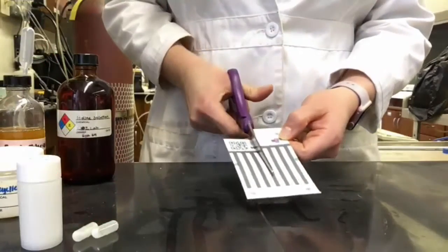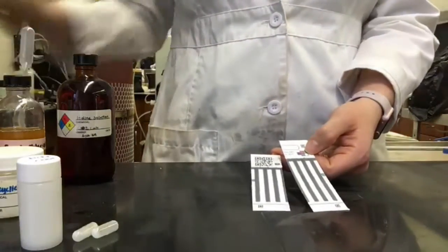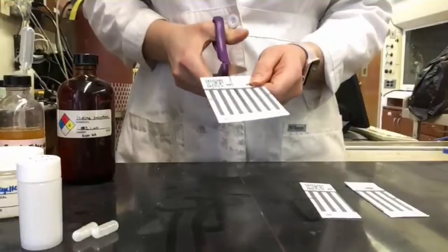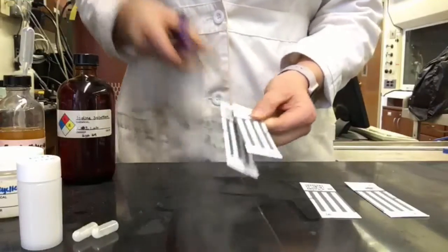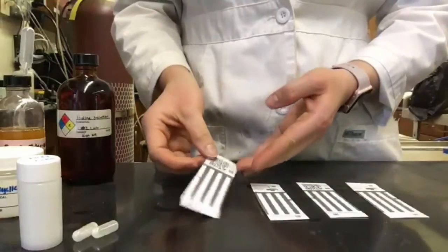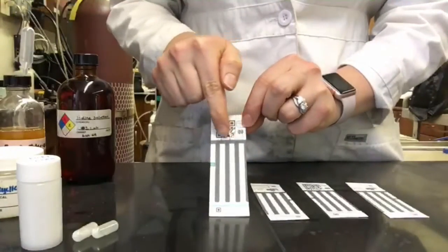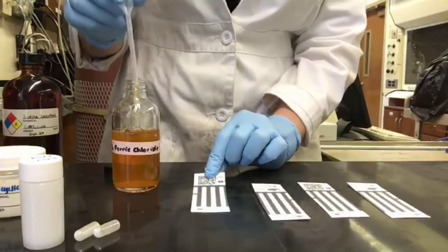After completing the solution tests, you will repeat these tests on paper. Each group will start with 4 of the blank paper analytical devices. The blank pads will already be cut for you. You will add your reagents to the top of the pad lanes. These lanes are labeled A through F at the top of the card.